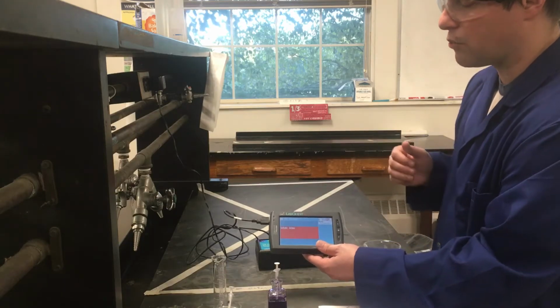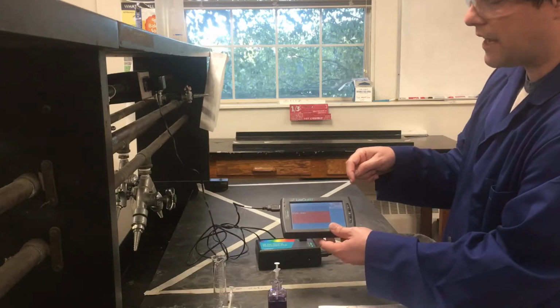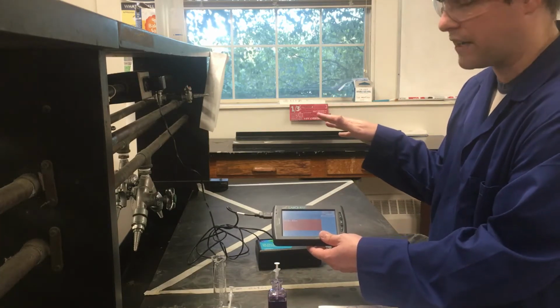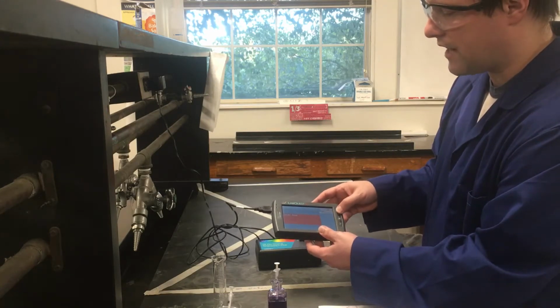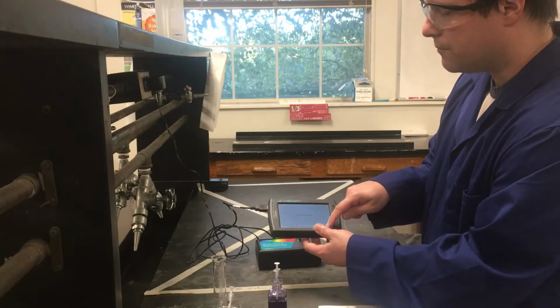But in this case, it's working fine, ready to go. It's already set up to do a full spectrum. And by a full spectrum, basically, it's going to scan at every wavelength in the visible spectrum and just see where it absorbs. So for me to do this, and actually I don't have my play button showing up down here, so I can just tell it to play with the little button that's here.